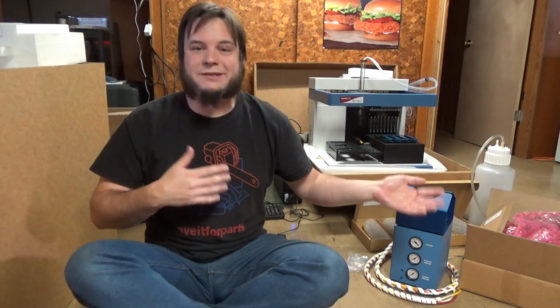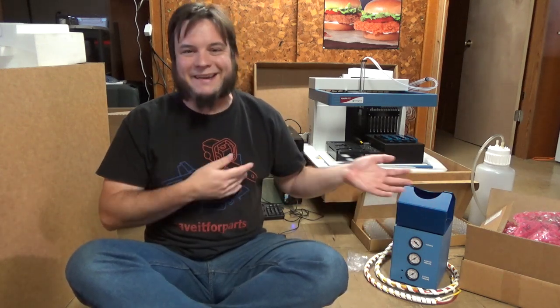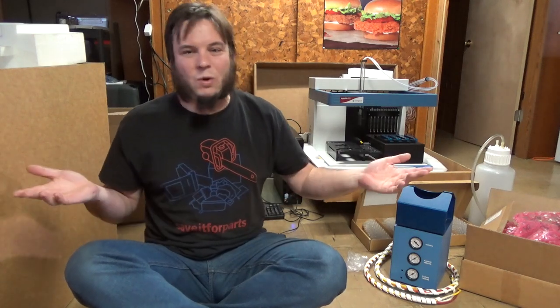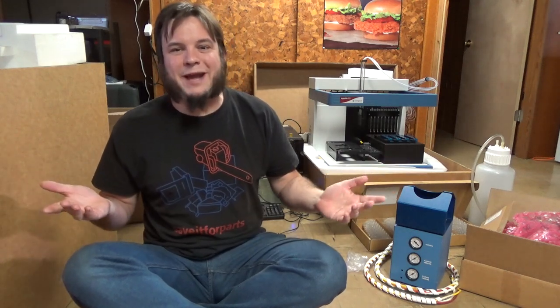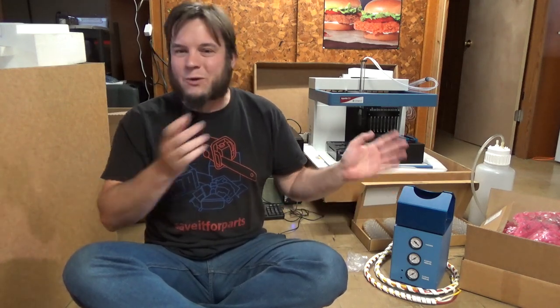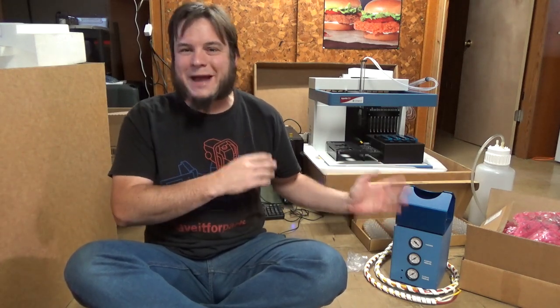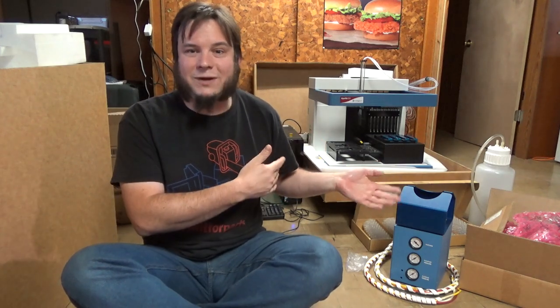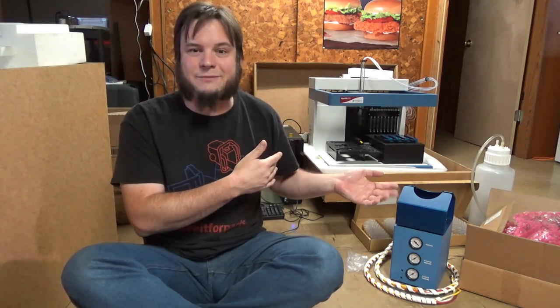All right, so my $85 DNA sequencer seems to physically work, although, again, I still don't know how it works, what it does, or what anything in the manual means. So we're a long way from actually doing any DNA sequencing with this. However, the mechanics of it seem to function, the software seems to function, and once I hack together some com cords for it, that all seems to work great.